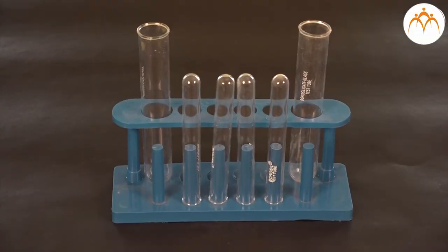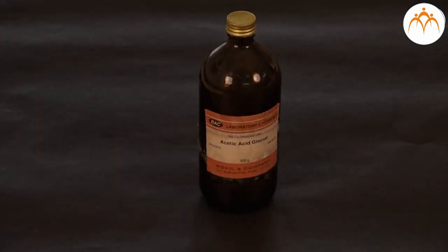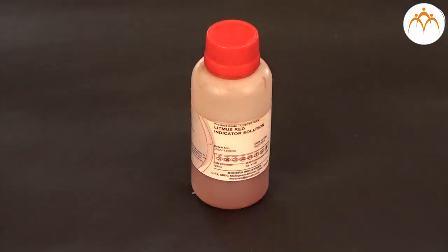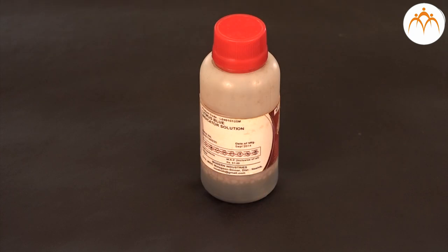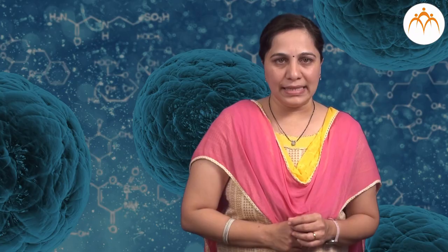In today's practical, let us study the physical and chemical properties of acetic acid. First, we'll see the apparatus: test tubes and test tube stands. Then the chemicals: acetic acid, red and blue litmus solutions, and sodium bicarbonate.